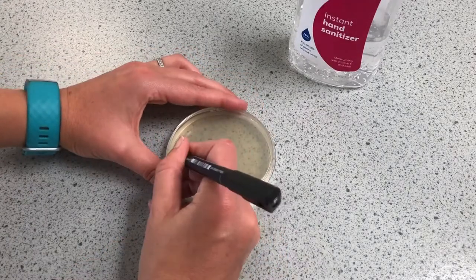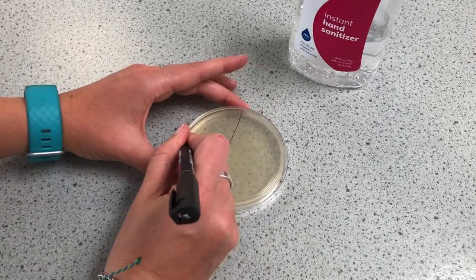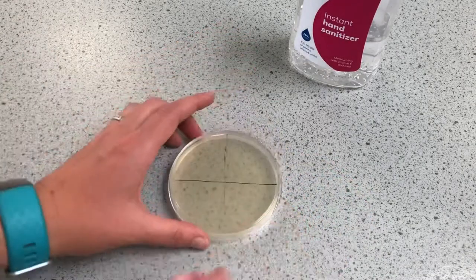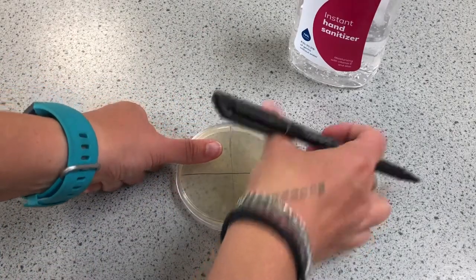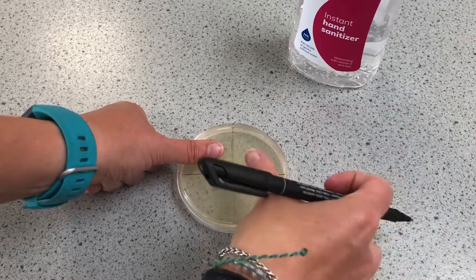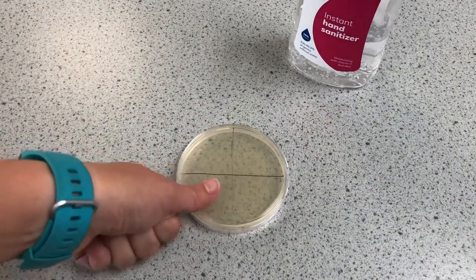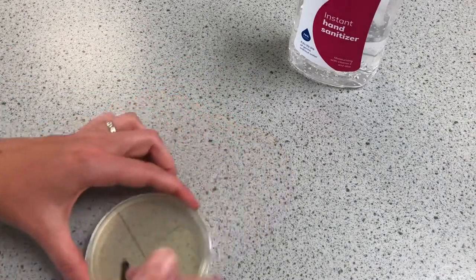I'm going to take my plate and on the bottom of the plate I'm going to split it into four. I'm going to put a thumb here and a thumb here. I'm going to sanitize this hand and put that thumb back, and hand wash this hand with soap and put that thumb back. I'm going to label it up now so that I don't get confused.